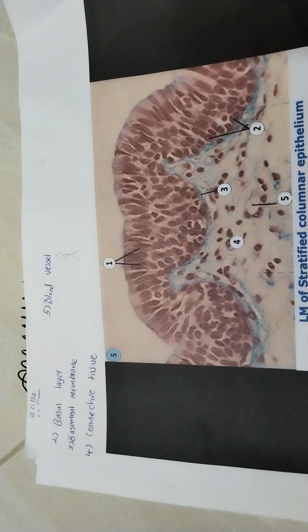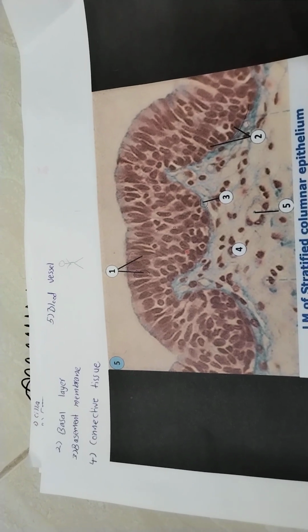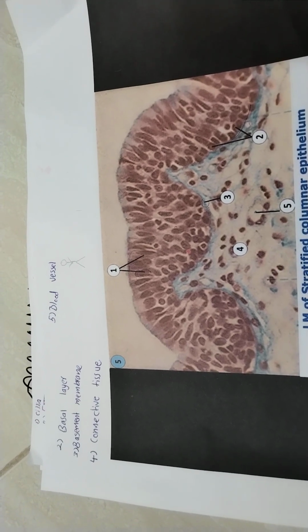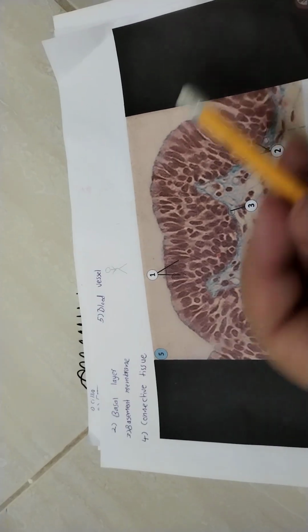Assalamu alaikum. Hello guys, in this video I will explain about some epithelial slides that you may get in college, epithelial and some new structures. I will explain it shortly in this video.